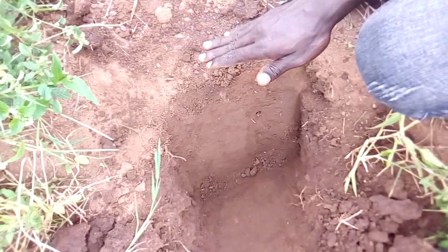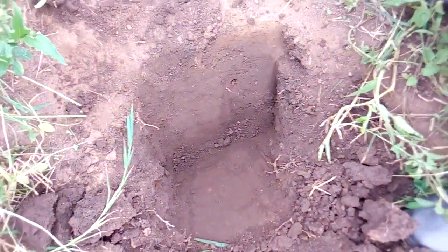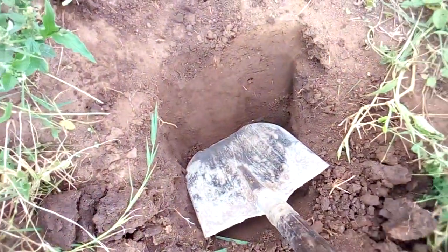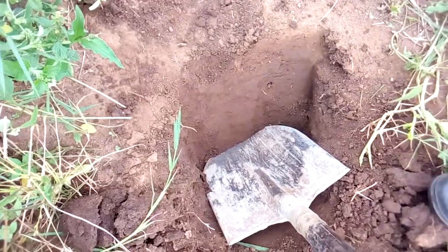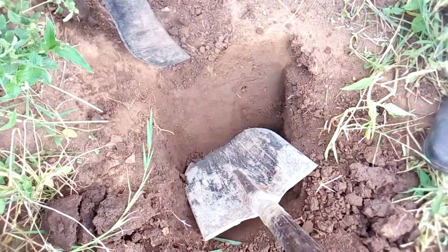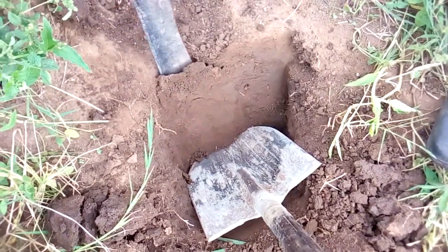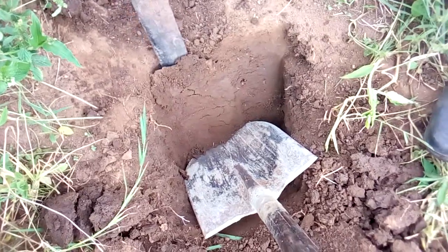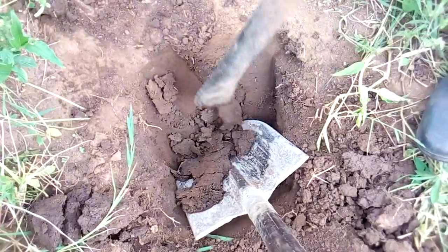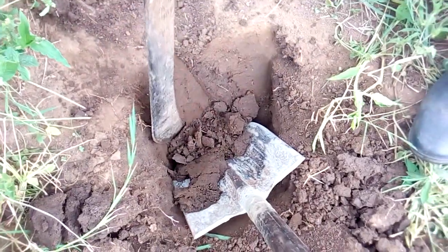So what we have done here is simply make the V-cut, and you bring your spade like this, try to press it down there, and what we are going to do is just slice from the top to the bottom of around 15 centimeters or 15 to 20, which is usually an optimal range.